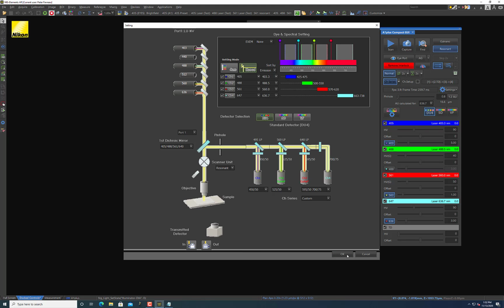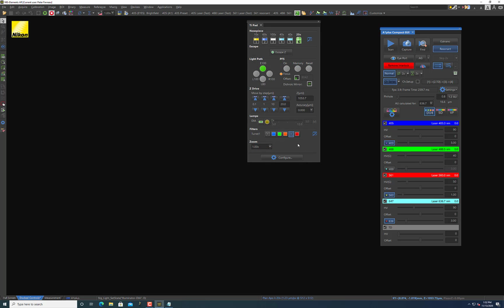So now it's not in there. Hit OK. And then you should be able to hit this again. And the light turns on. And indeed, when I did that, the light came back on. And now I have Brightfield Illumination as an option again.